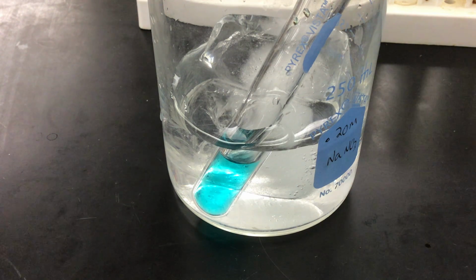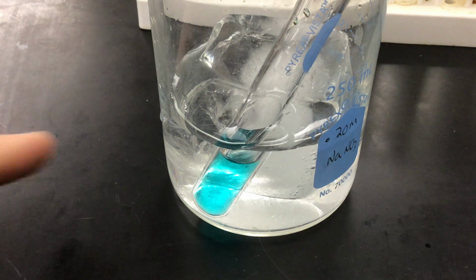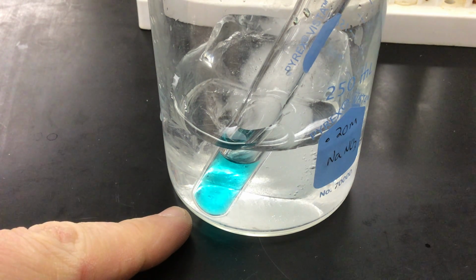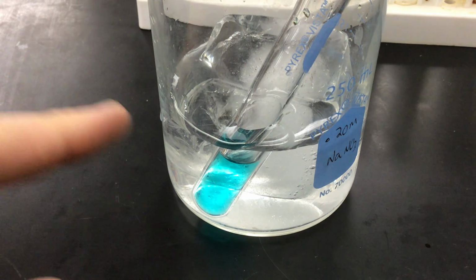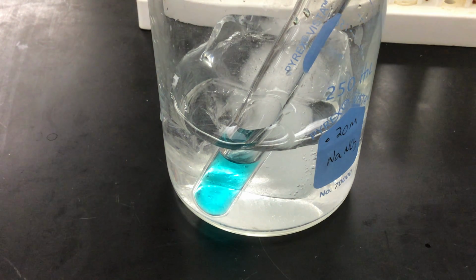All right, in reaction number 5 of the copper cycle, we are starting now with the copper substance, which is copper(II) chloride. It's a solution here, and I've had it in an ice bath for a few minutes so that it's really cold. The purpose of this is to slow the reaction down so that it isn't too vigorous, and it's a way to kind of control it.